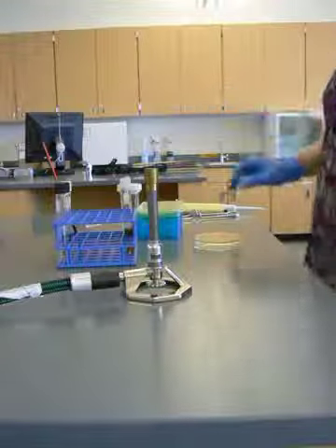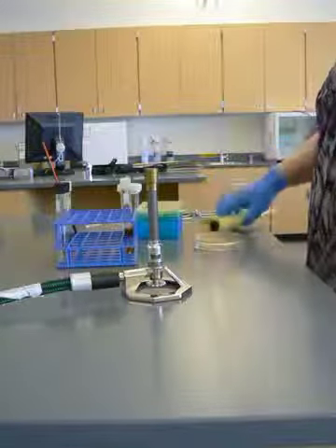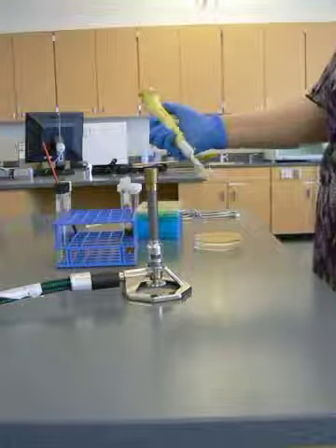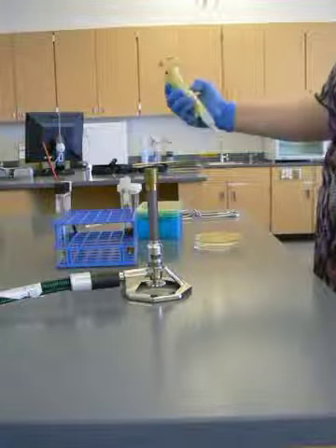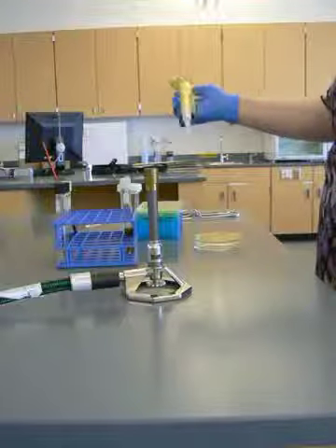I'm going to demonstrate how to do a spread plate. So I'm going to need my micropipetter, which is set to the amount that I want. I've got it at 10 microliters, that's what I want.